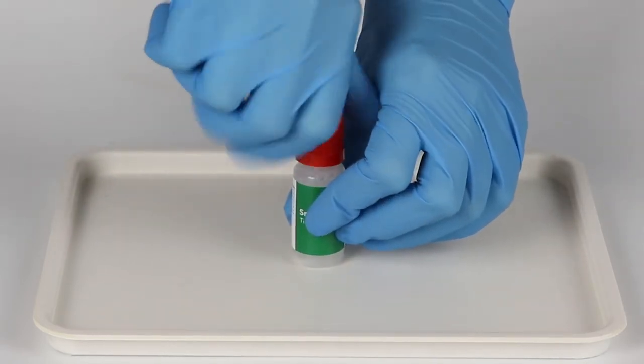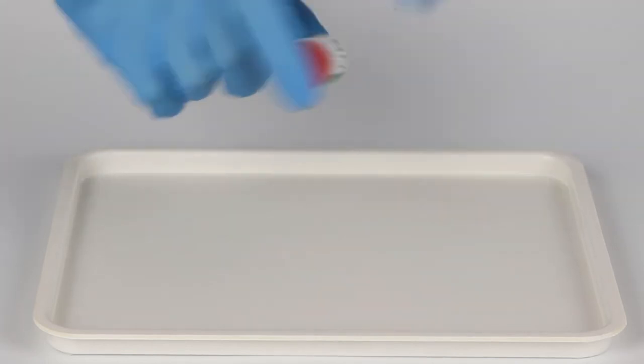As an alternative, you can use the white cap from the bottle of the Sodium Hydrogen Sulfate Solution. Shake the bottle well to mix the contents.